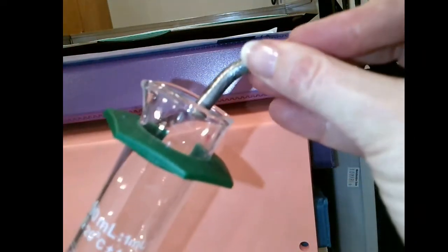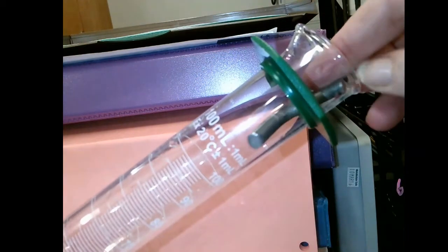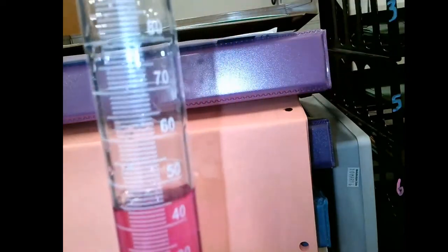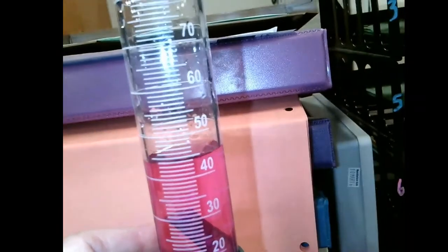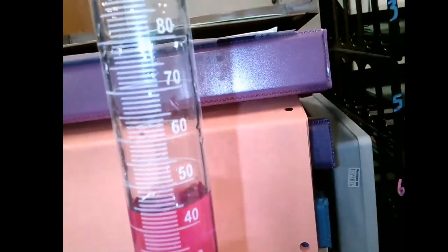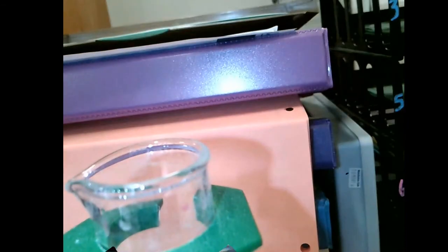Now, if I use this metal and I drop it straight in, it'll hit the bottom with a lot of force. So tipping it on its side is going to allow it to slide carefully in and then be able to record a new volume. Now, if you notice, this is a very small change in the volume, not a good measurement. You really want to try and have this go up by 10 milliliters with your sample. So this is way too small of a sample and will lead to a significant amount of error in my observation.